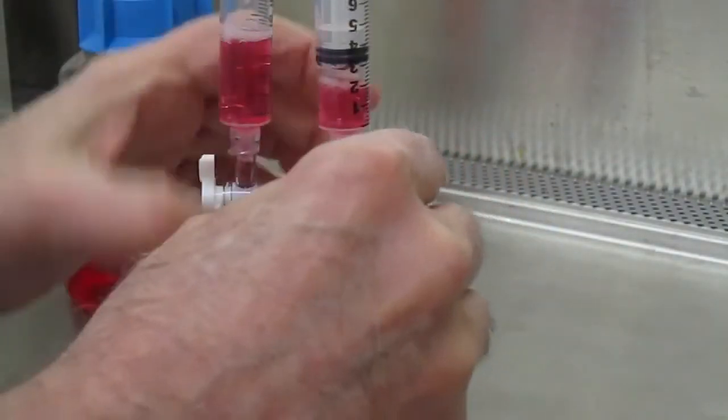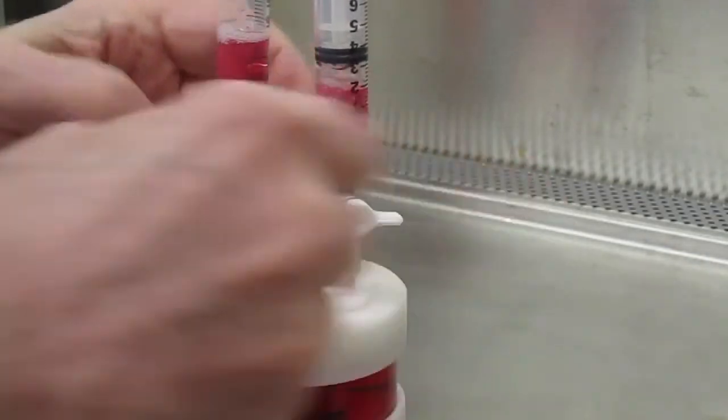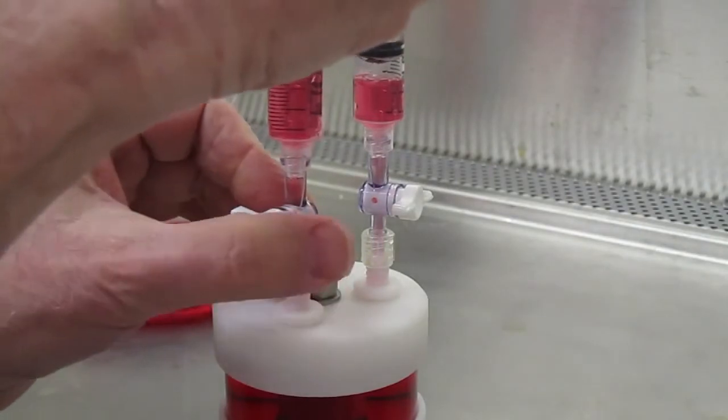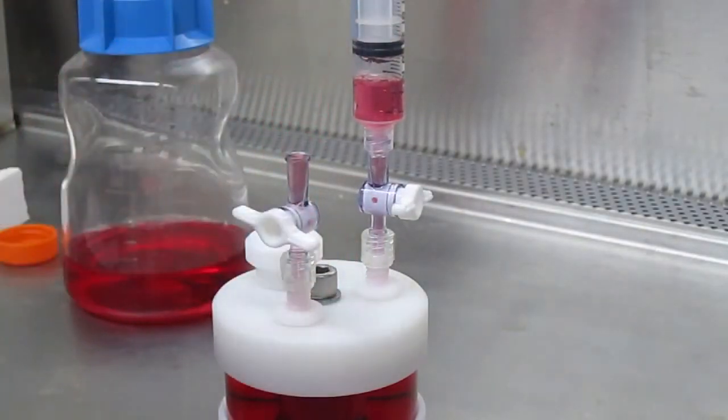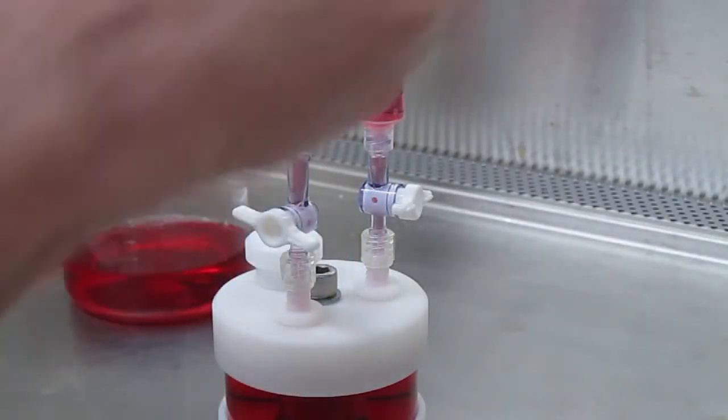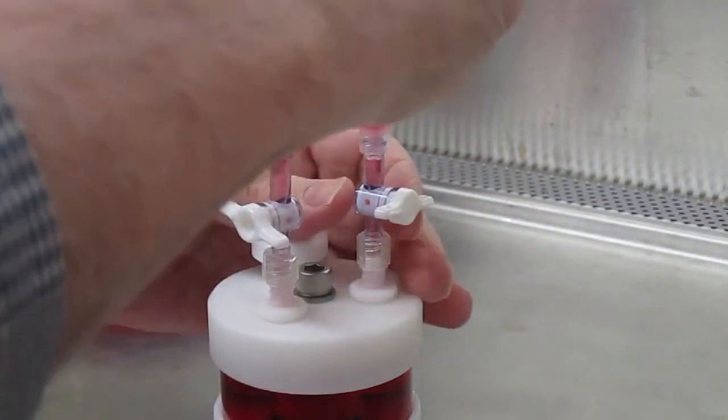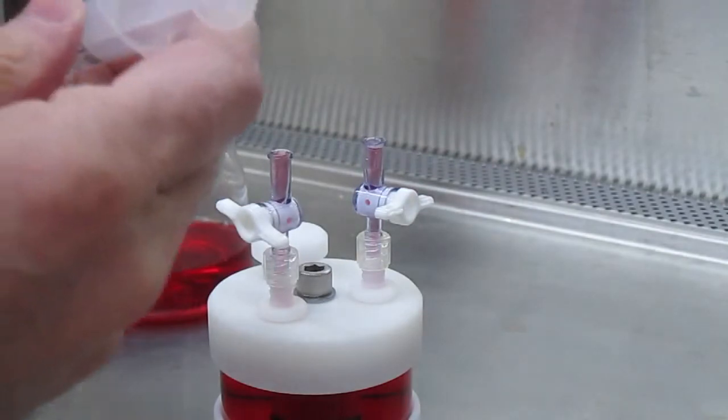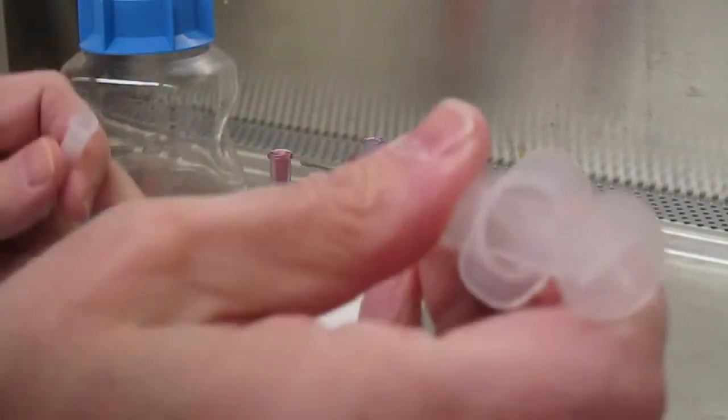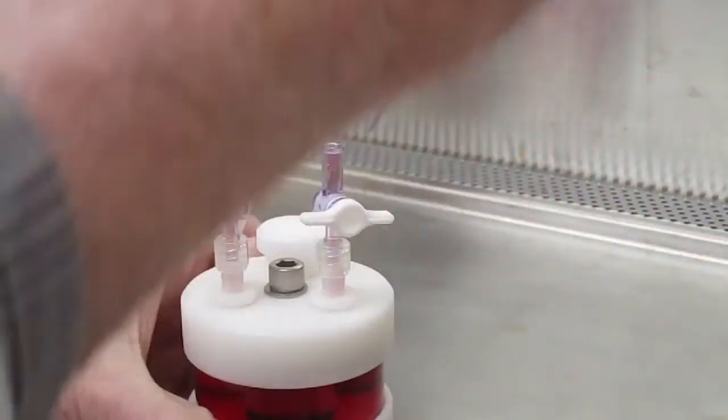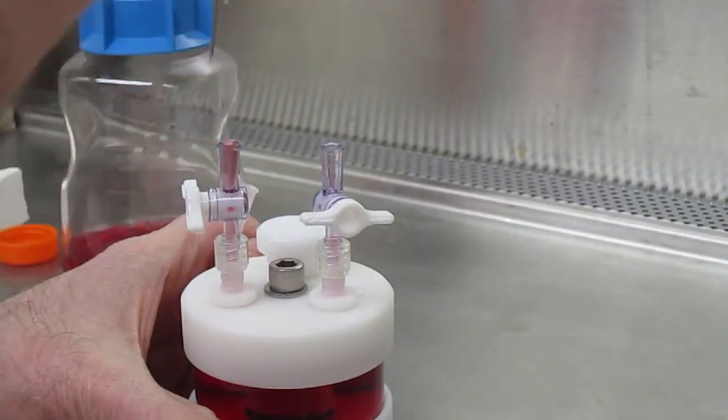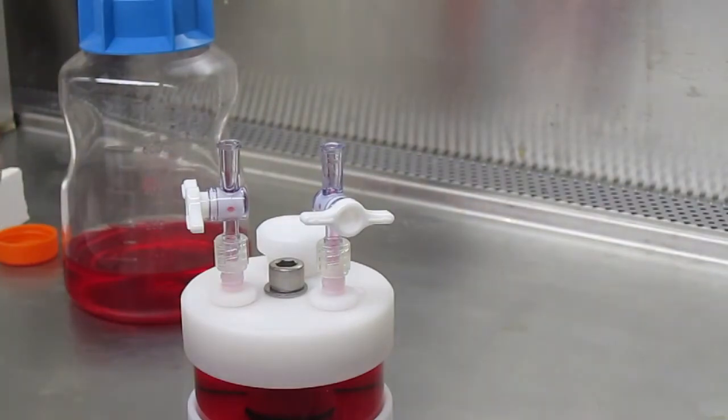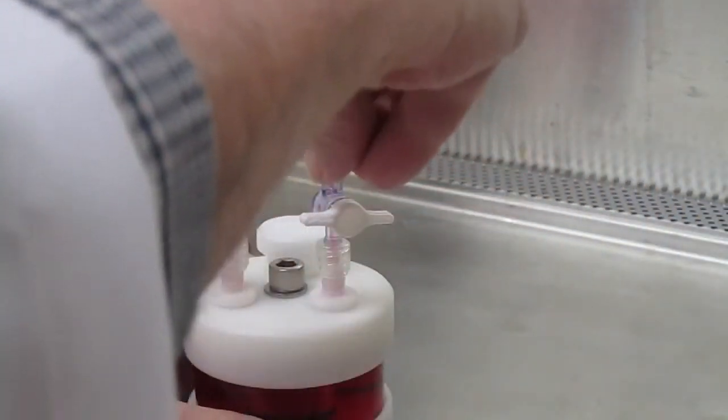When all the bubbles are out, the valves are closed and the syringes are removed. We recommend that any remaining media in the valves be removed and then the caps are replaced.